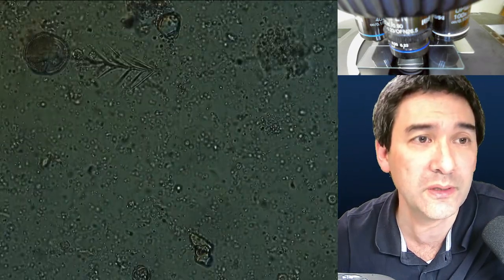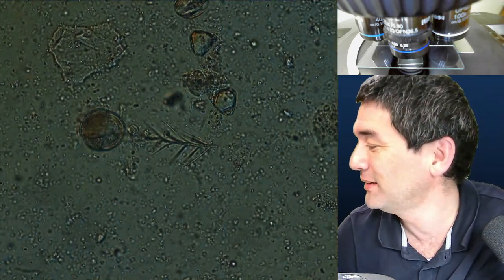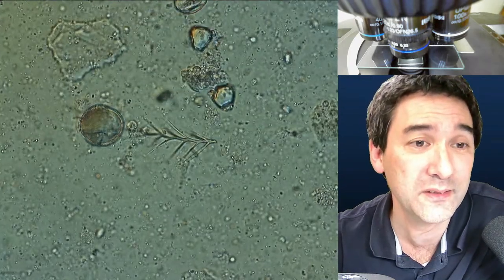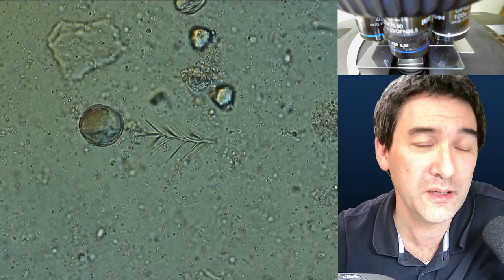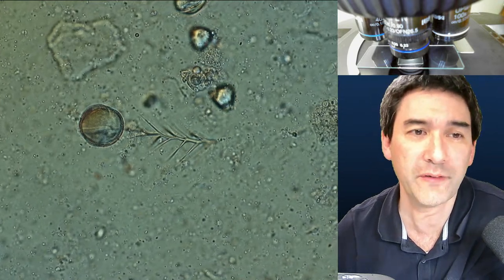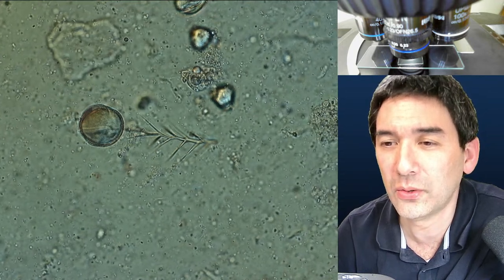I was looking for this — a feather-like structure. You see this feather-like structure here? That is actually a structure from a bee. In honey, I have found this several times already — not very common, but this feathery type structure. So occasionally in honey you do see some notable structures from bees.